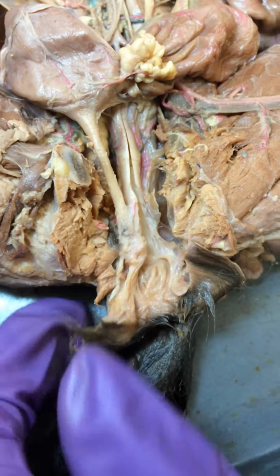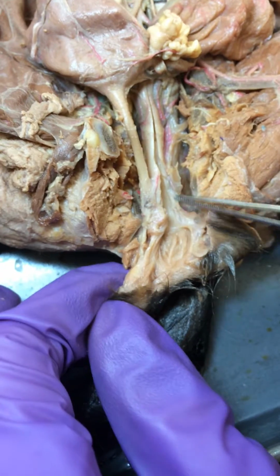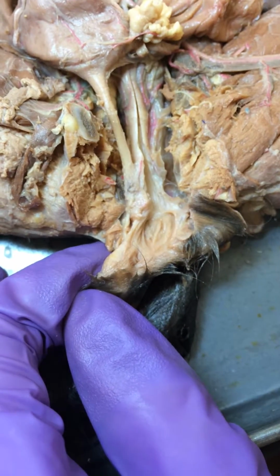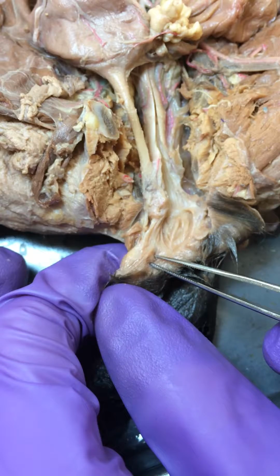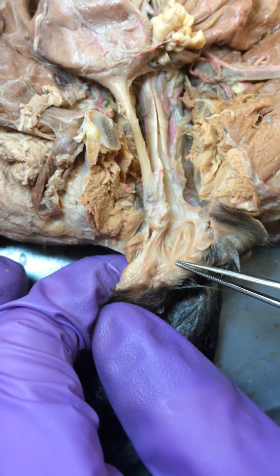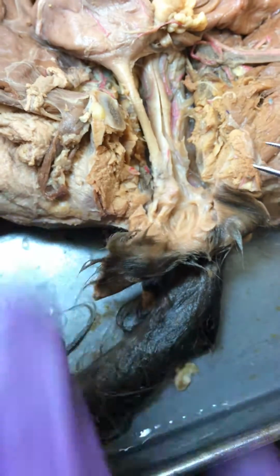And then the glans clitoridis is on the same line at the mid-ventral line of the body in the vagina as the vaginal vestibule and the urethral orifice, and it's a little swelling inside of a ditch, and ours is right there. Now if you were to cut open this flesh, then you would get to the actual body of the clitoris. It's a structure, but we're not going to do that because who cares?